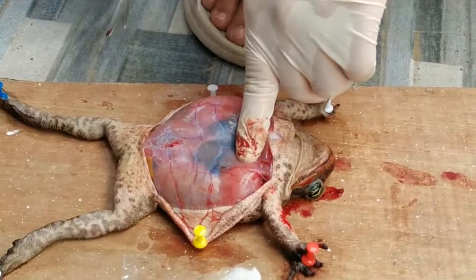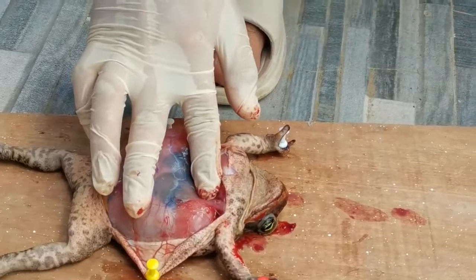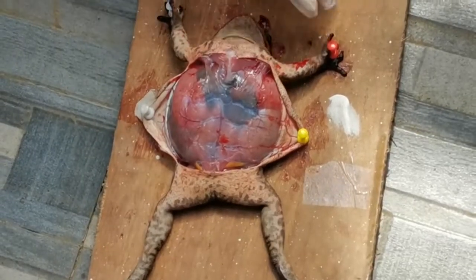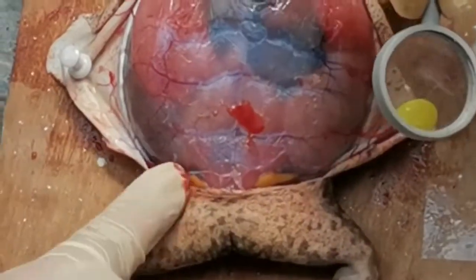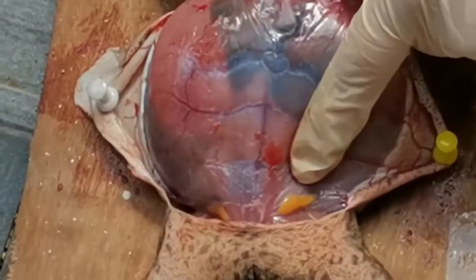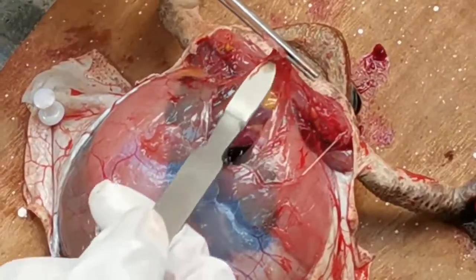The sex of the frog is readily noticed once the internal organs are exposed. If there is a mass of black and yellow eggs in the transparent ovaries, the frog is a female. If the ovaries obscure the view of the other organs, the ovaries may be cut out of the body and removed. Find the heart in the center of the chest cavity.